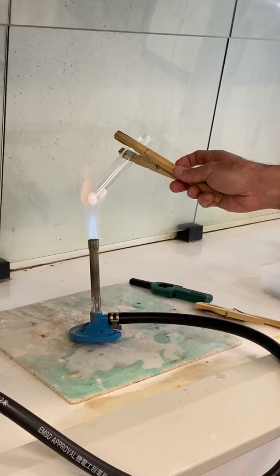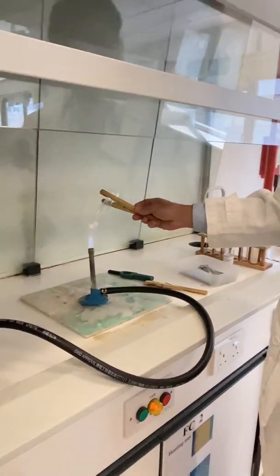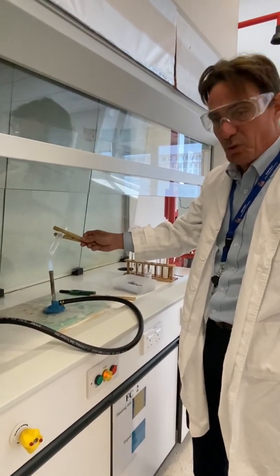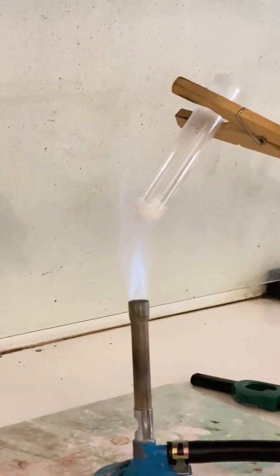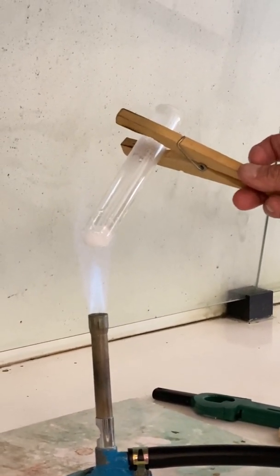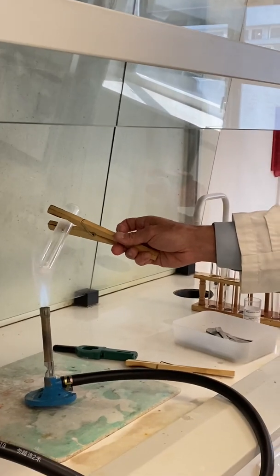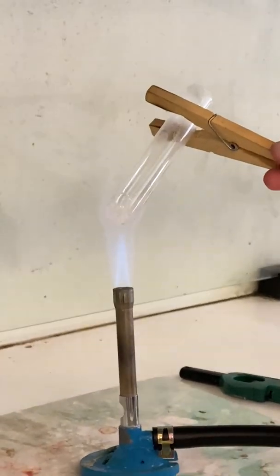The lithium cation has a very similar charge density to the magnesium cation. Notice again this is the hydrated form, so the initial thing we're seeing coming off is a lot of water — the waters of crystallization are going to boil away. In fact it's sort of dissolving in its own waters of crystallization. What we're hoping to see is brown smoke again. Will the lithium cation be able to polarize the nitrate ion like the magnesium 2+ cation was able to do?